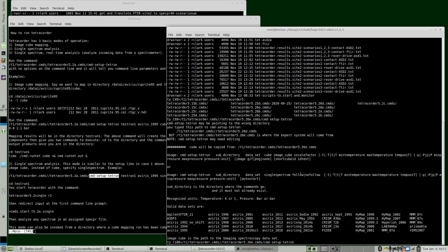So in this case, we need a subdirectory, and we were going to use a directory similar but different than the current directory. Our data set is Agilent FTIR. That's over here. So we copy that. Then we need, after dataset, single spectrum. We're not going to follow a growing file, so no follow. Minus T for temperature, minus 10 to 30 centigrade. Pressure, bar, and that's all we need.